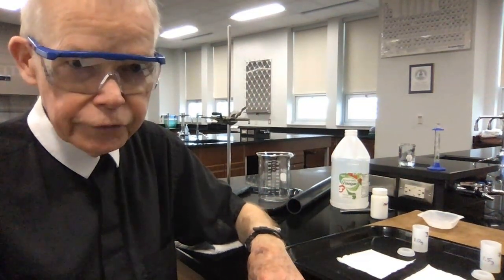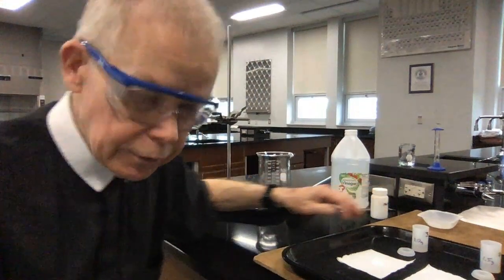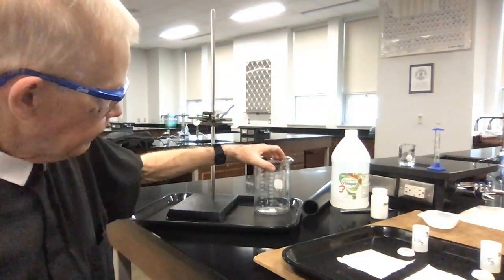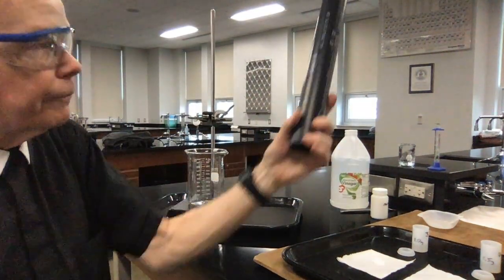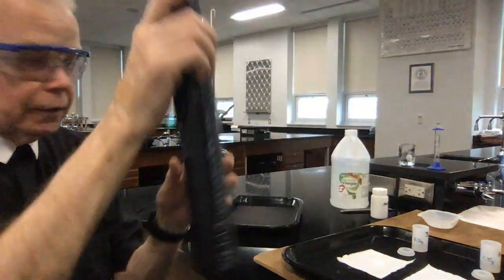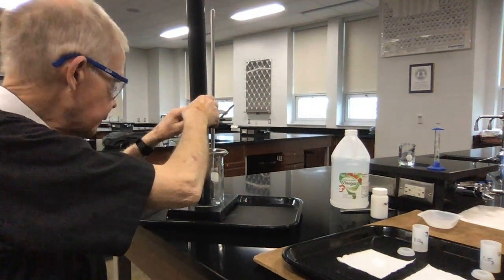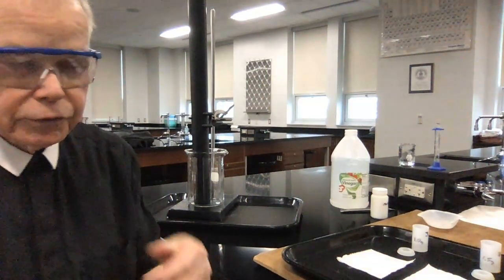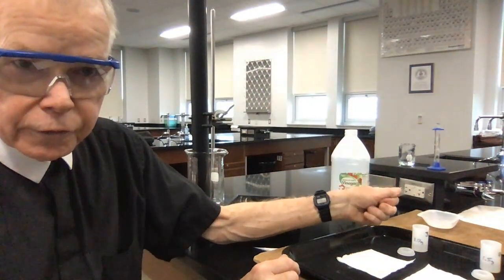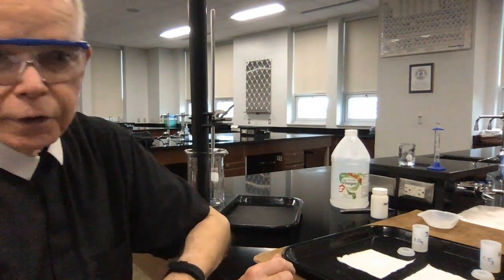Now, when I say push the lid off, it sometimes does that with a lot of energy. So to capture that and take a better look at it, what I've also done is put together a lab stand. I've got a big beaker here, and I have bought some PVC pipe, plastic pipe. It is hollow. Let's see if we can get you to see that. Yeah, good. And what I'll do is put this into a clamp, put it all the way to the bottom, clamp it up, and then when I get outside, I'll take a little bit of tissue paper and drop it in, close the lid on the little canister real quick, and flip it over upside down and put it into the tube.